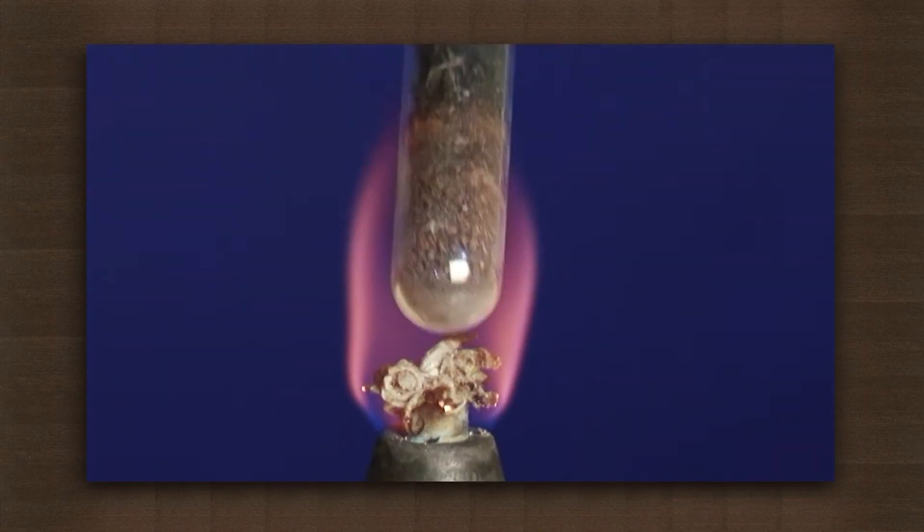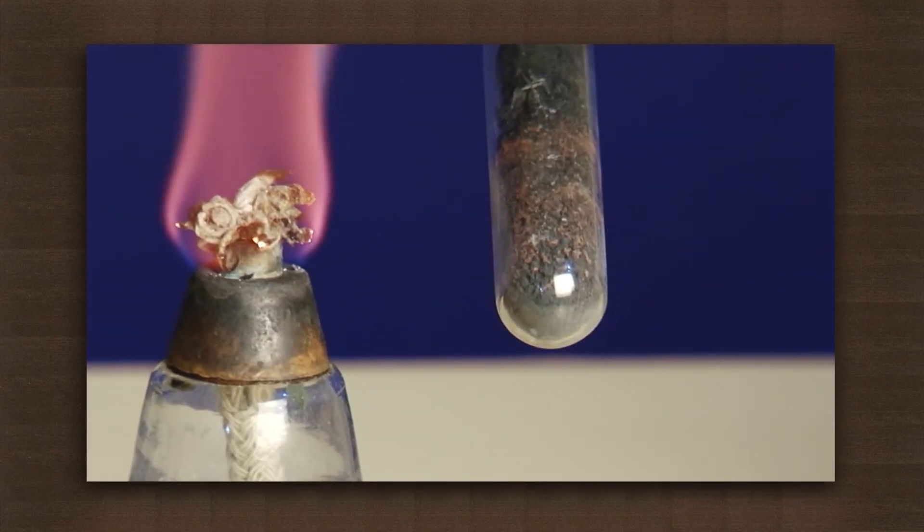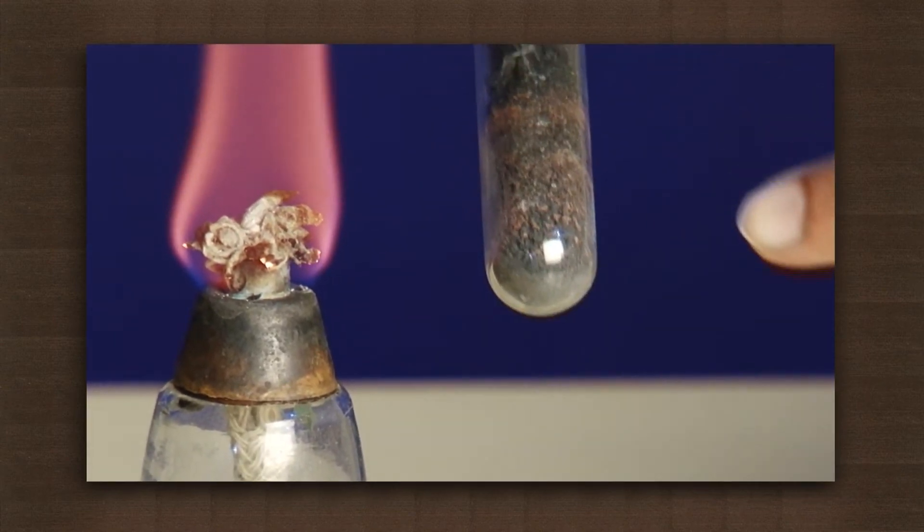After some time look closely at where the powders meet in the test tube. You see traces of copper can be seen in the test tube.